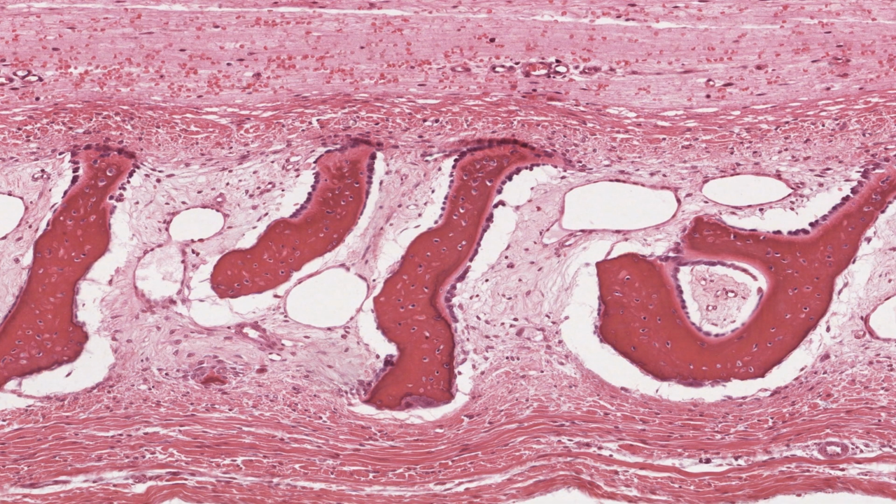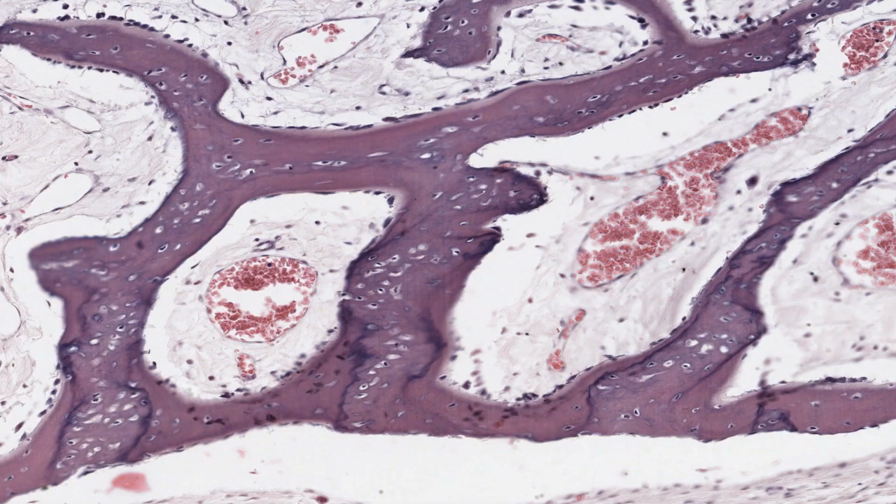This lighter staining band on the surface of the spicule is matrix that has not yet calcified, and so it's called osteoid or pre-bone. This woven bone is temporary. It forms a scaffold for lamellar bone to be deposited onto. After the sheets of osteoblasts have laid down a sufficient amount of woven bone, the cells abruptly change to synthesize lamellar bone, the adult form of bone.